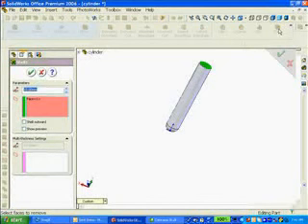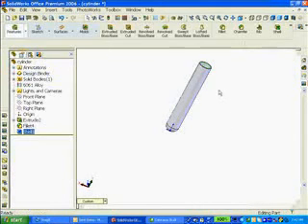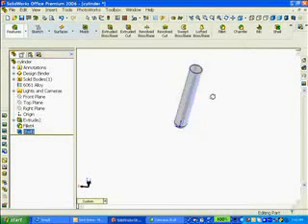Well, that depends on the material of your tube. Some glass tubes, like disposable glassware, have a wall thickness of 0.65 to 0.75 millimeters. You also get into the plastic disposable tubes, and those wall thicknesses can vary depending on whether the material is polypropylene or polystyrene. For our example, let's just try 1 millimeter. It's a good first guess. Click OK. Now the test tube has been hollowed.